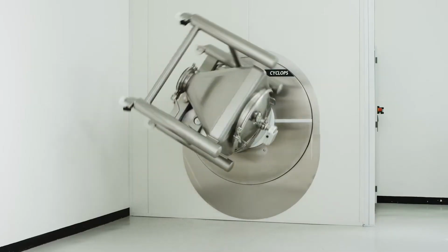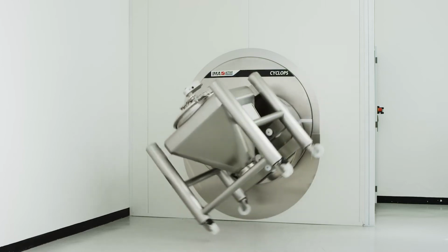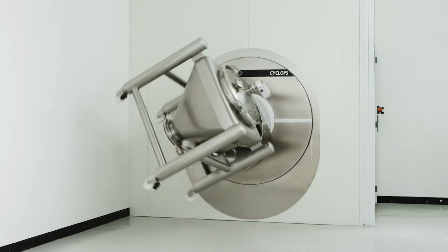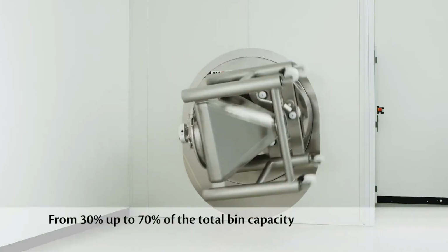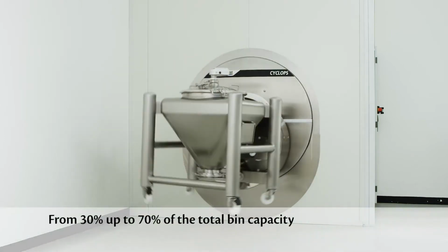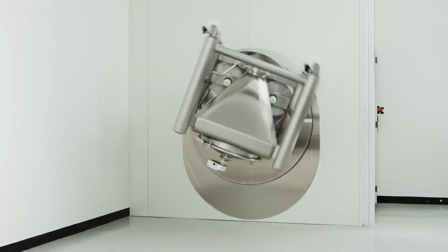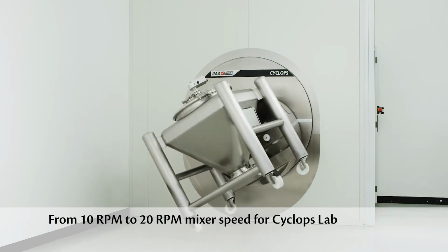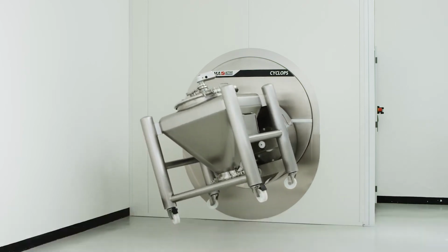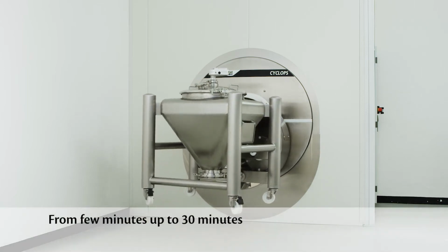The main critical process parameters that are taken into account to get an optimal blend uniformity are basically three: bin filling, from 30% up to 70% of the total bin capacity; mixer speed, from 10 RPM to 20 RPM; and mixing time, from a few minutes up to 30 minutes.